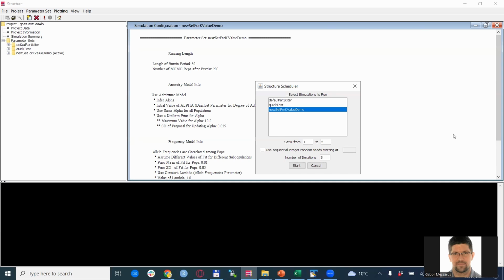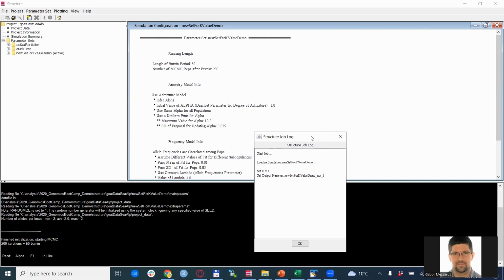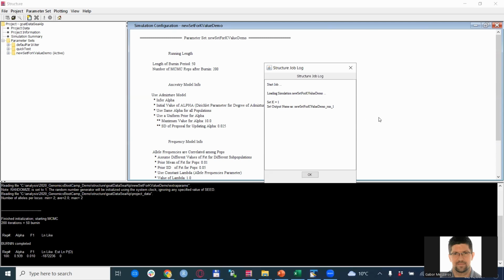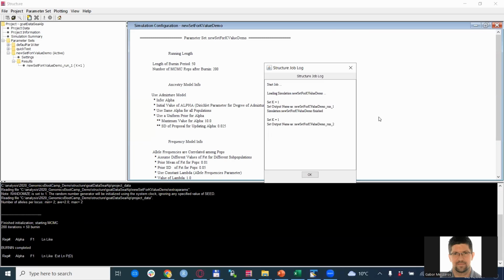I think there is a minimum of 3 iterations each that you need to do for this Evanno method. Of course, the more the merrier. Maybe you don't need to overdo it, but still at least 3 must be done. So you click start here, and the runs have already started. It starts with K equals 1 and the first run. K equals 1 would run 5 times, then K equals 2 also 5 times, and so on up to K equals 5. Once this process finishes, then we can proceed with the actual use of Structure Harvester.